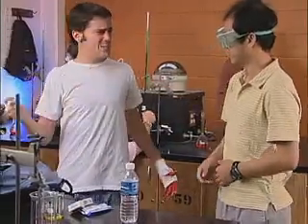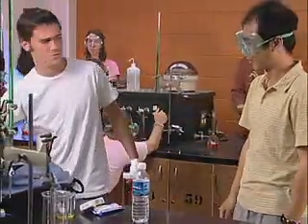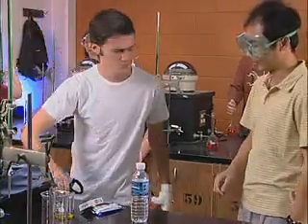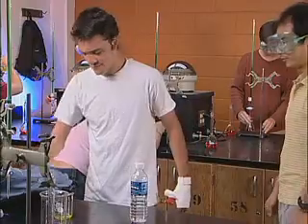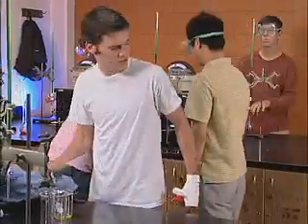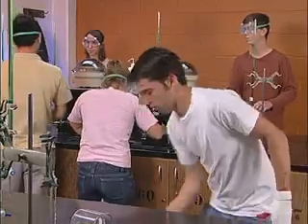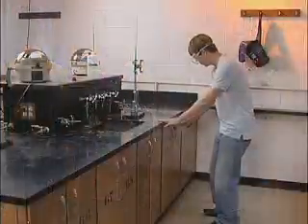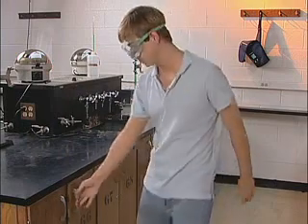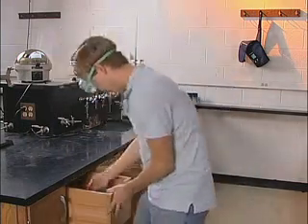Rule number 6, eating, drinking, smoking, chewing tobacco, and applying cosmetics are forbidden in the laboratory. Rule number 7, all accidents and broken materials must be reported to an instructor immediately. Ow!